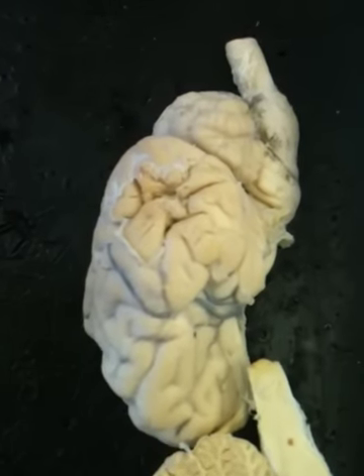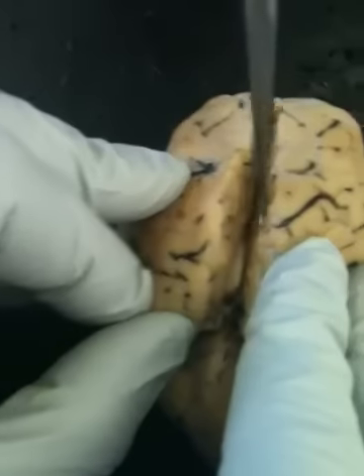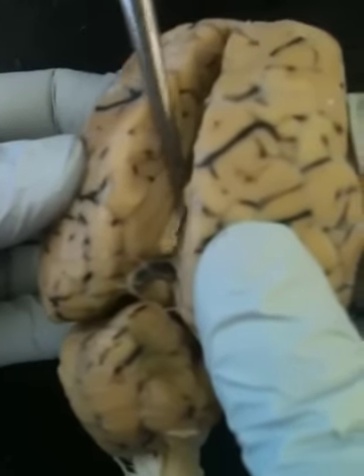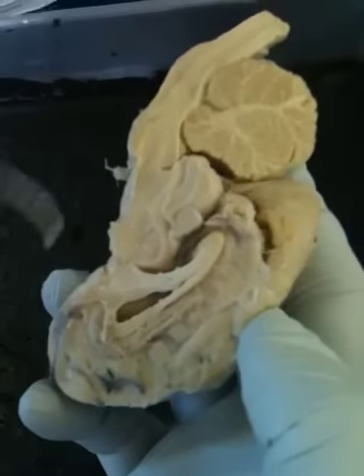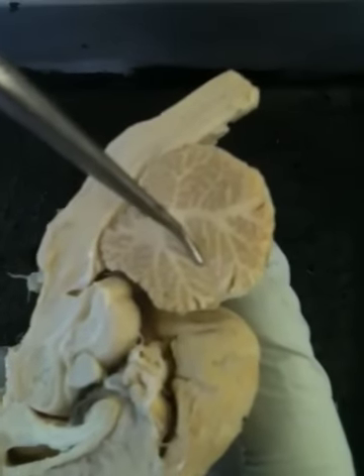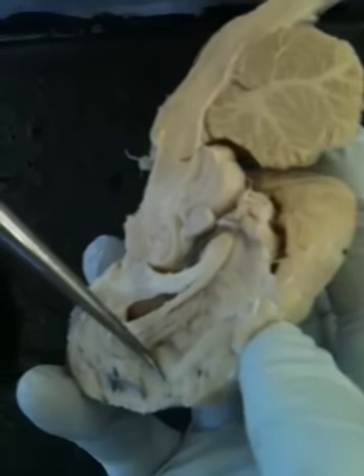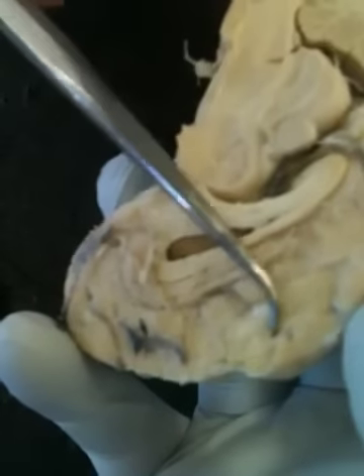The corpus callosum, when you split the two lobes, you can see this white part sticking out right here. It's the bridge between the two hemispheres. The gray matter, you can see it best on the arbor vitae. It's this tan color. The white matter is this cream color. But I think you can also see it on the cerebrum. White matter, gray matter in between, kind of.